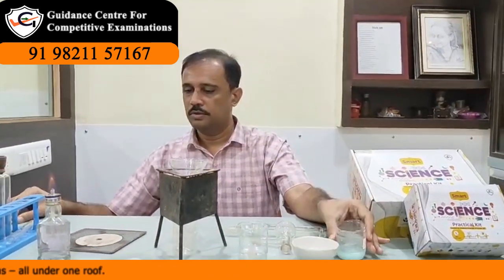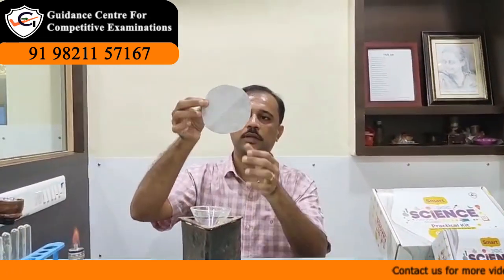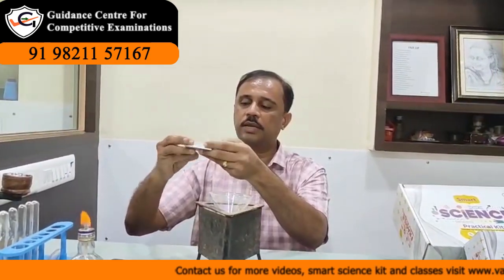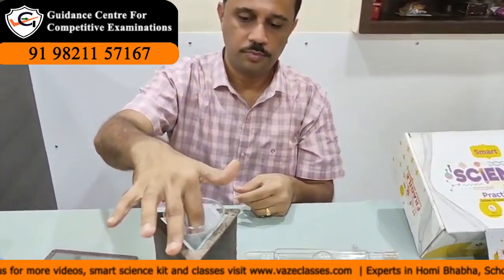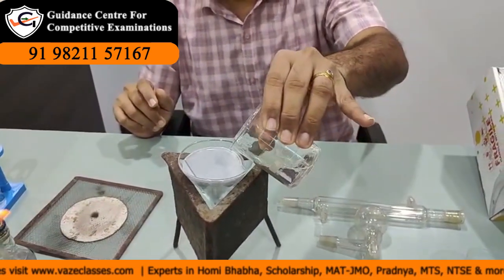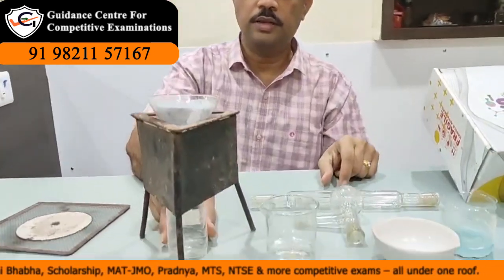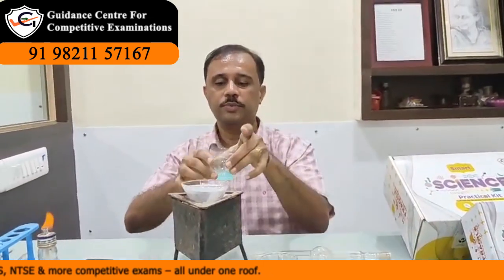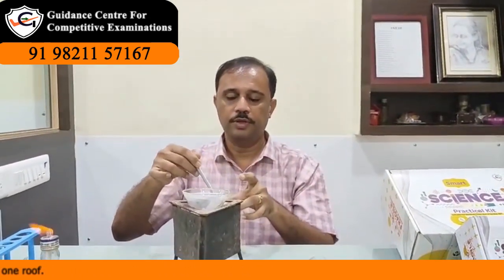Now we will filter the mixture. This is filter paper. I will prepare a cone of it, fold it like this, again a second fold, and make a cone. Add a few drops of water so that the cone fits on the funnel properly. This is a collector to collect the filtrate. I transfer this mixture to the funnel.